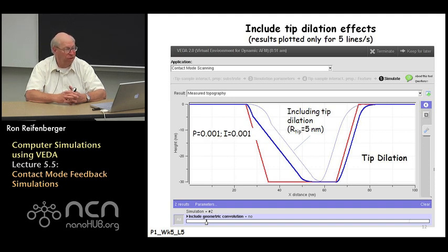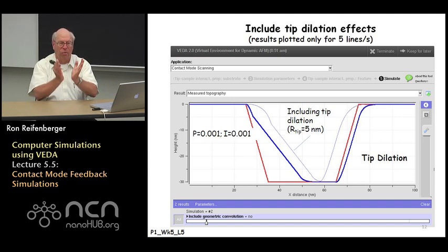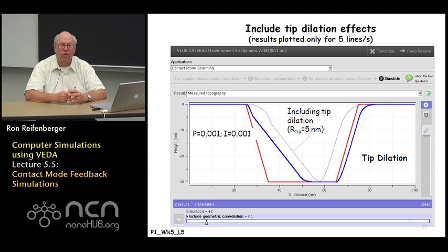You certainly get the depth of the feature correct. You would misinterpret the leading edge, and so it would be difficult for you perhaps to estimate accurately the width of the feature. The situation gets much worse when you turn on the tip dilation effect. In this particular example, I've got a tip radius of 5 nanometers, which is a reasonably sharp tip. And you can see that the light blue curve in this simulation really shows up as a triangular divot, a triangular wedge in the substrate. It's not even close to the trapezoidal feature that we specified.